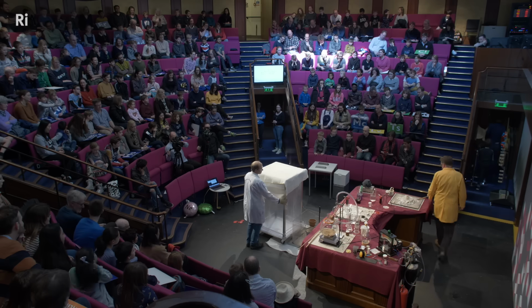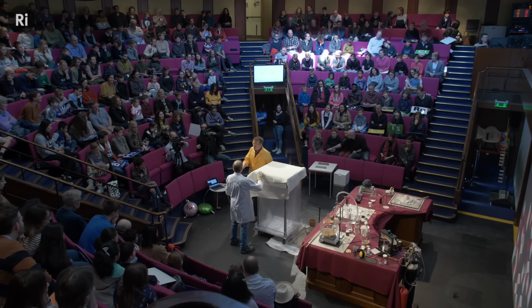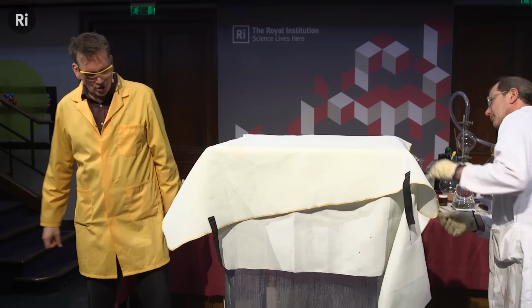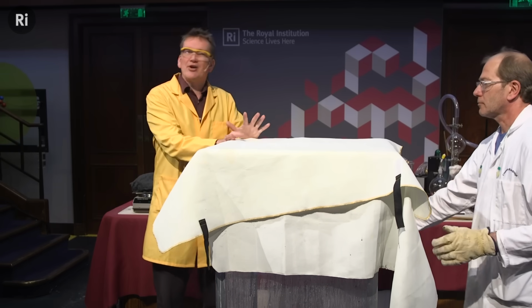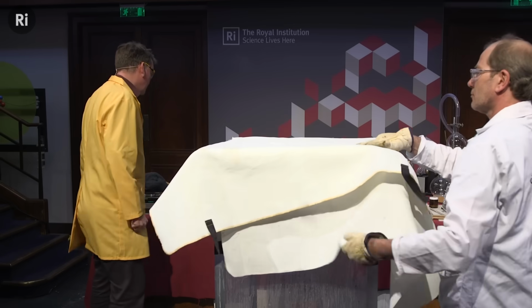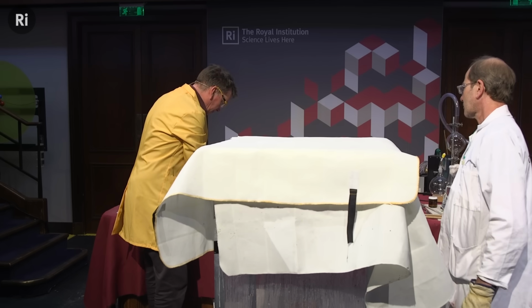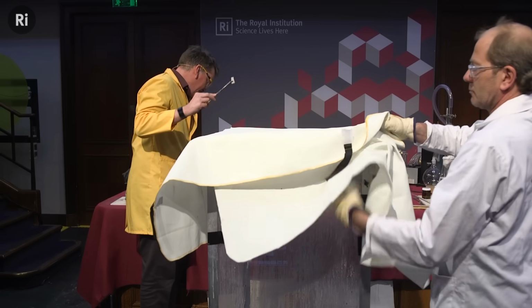Okay, so this is a special tank designed to do this reaction safely. I can just ask you, for this one, if you can just move back just a little bit. Good, thank you. So this is made of super strong polycarbonate. There's water in the bottom of the tank, and there's actually 3 different lids on top of this. And this is to make sure that this is safe to do the experiment, because we're going to use a larger piece of sodium. So I have some larger pieces here. Okay, and here is my larger piece. It definitely is larger.